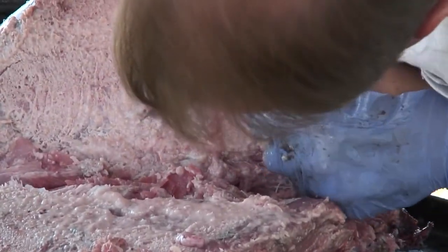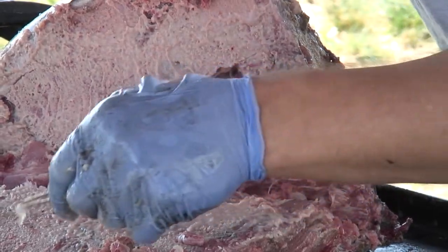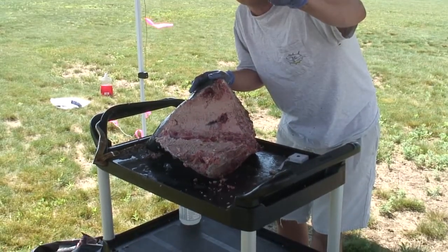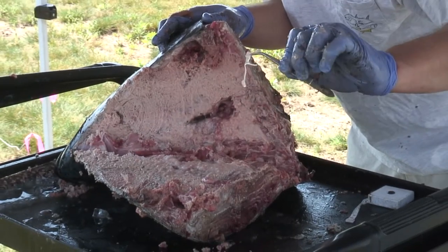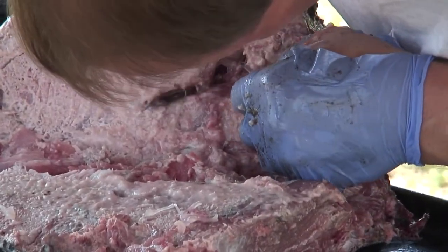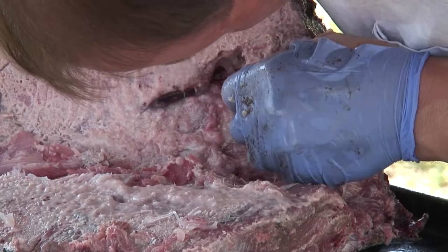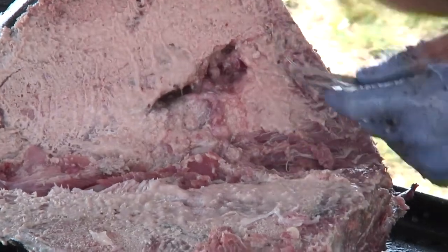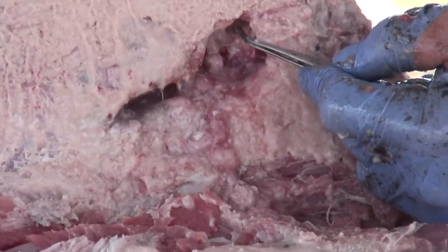There's part of the canal, and there's the other part of the canal. So this is what you're looking for — these structures, like little pieces of spaghetti, kind of clear and very rubbery. Find these and you can find the otoliths. Now that we've removed those, there's a little bit more material that we need to get rid of. Once we do that, the otolith is right here, right at the tip of those forceps — you can almost see it sticking out.